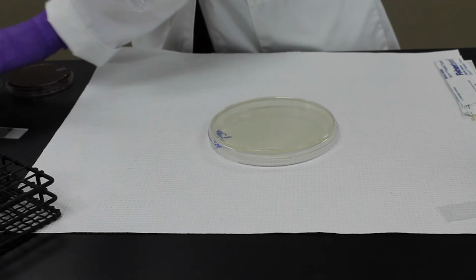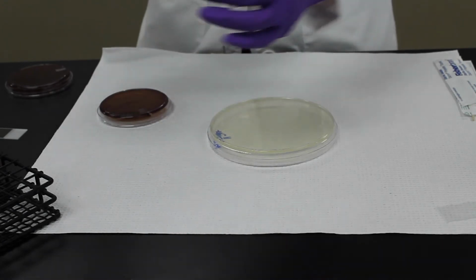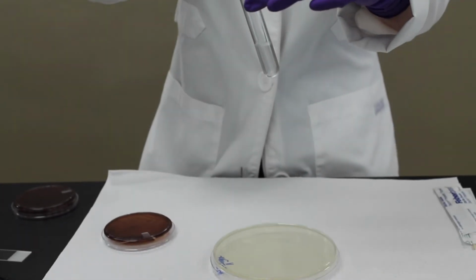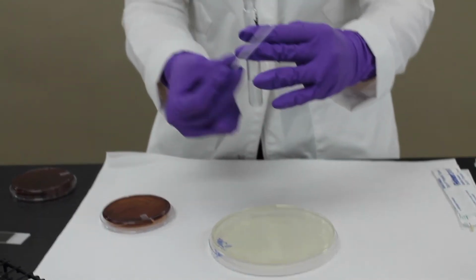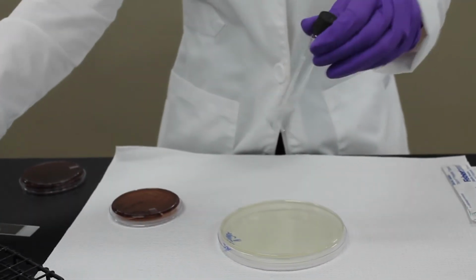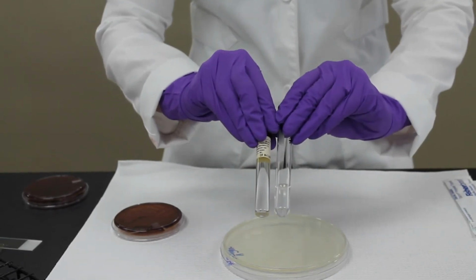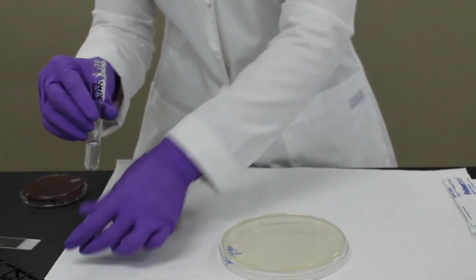So we're going to take a colony from our blood agar, using a sterile swab, and inoculate our saline. We want to do this a little bit at a time, and we don't want it too opaque because we don't want to have a completely overgrown plate. So doing this a little bit at a time, we'll compare it to our McFarland tube over here. And so they look about the same in the light, which tells me I can swab the plate.